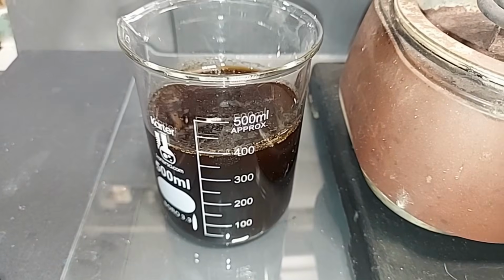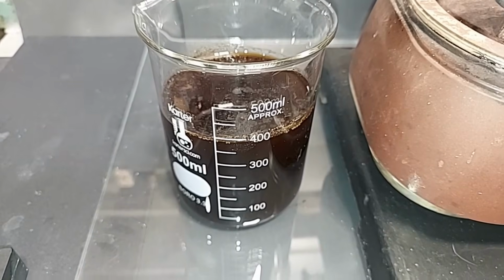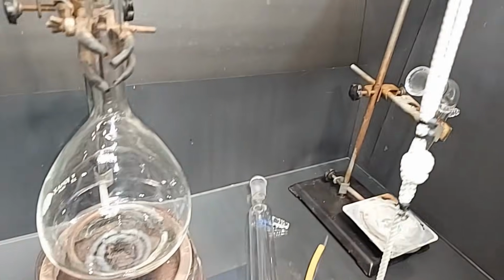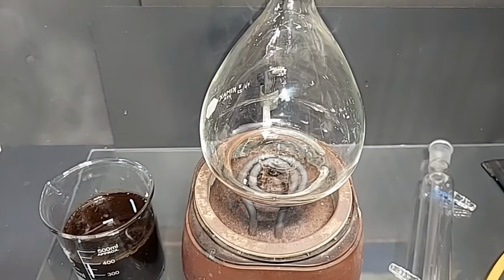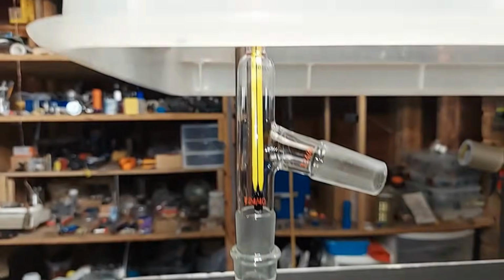Here's the solution. I had to pour it in here because you partially saw what happened where it bubbled and frothed. It ended up going up and over the distillation tube, which of course you don't want. So I poured it back in here and I've cleaned up everything. And what I'm going to try now is this 1 liter volumetric flask. I've never done this before. You saw this earlier, but I got to work with what I got here. So hopefully this will work so that the bubbling and frothing, which is going to occur again, doesn't make it all the way up and over.